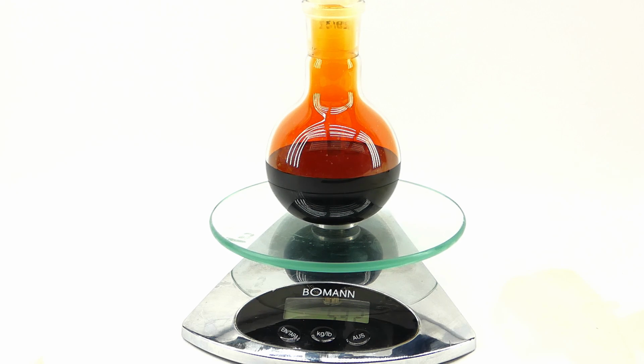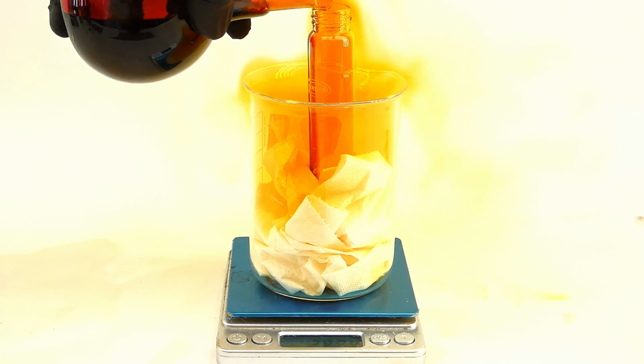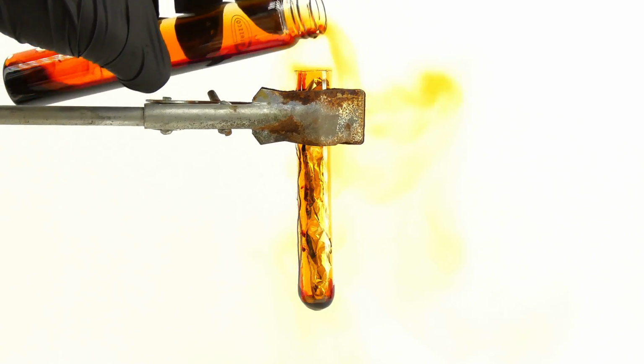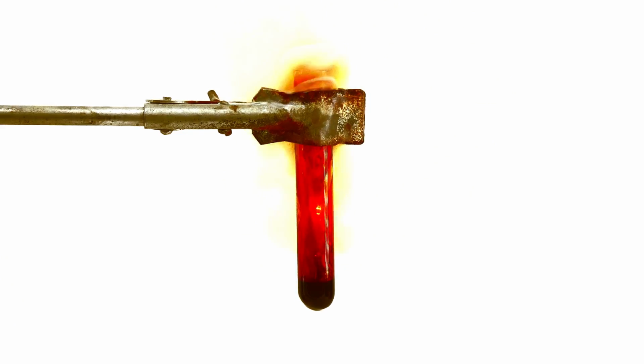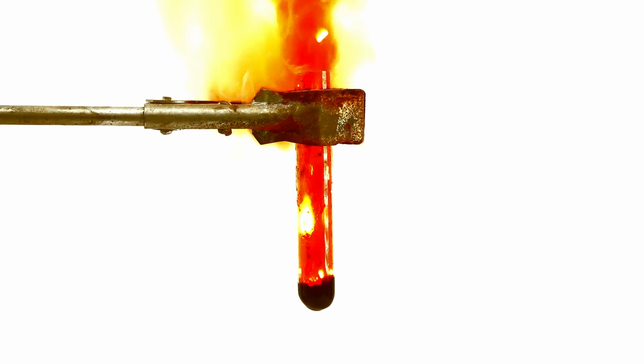However, before using all the bromine for it, I got about 20 grams of it into a vial to do some experiments with. As the first one, I wanted to do the classic reaction of bromine with aluminum, so I got some aluminum foil into a test tube and poured in some bromine, which quickly reacted to form aluminum bromide and a lot of this nice deadly smoke and sparks. This reaction also demonstrates that bromine should never be kept near aluminum, because it can end very badly.